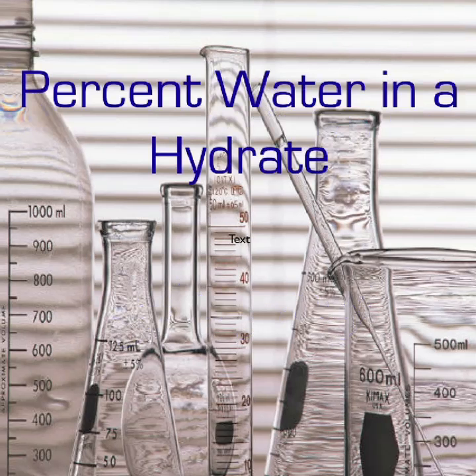In this experiment, you will test copper-2 sulfate to determine its water of hydration. Although the water molecules are securely attached to the ionic solid that you will test, they are susceptible to removal by heat. You will gently heat a sample of the compound to drive off the water of hydration. By measuring the mass of the sample before and after heating, you can determine the amount of water in the sample and calculate its water of hydration.